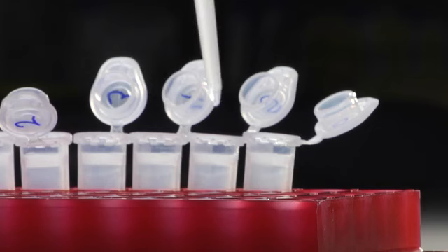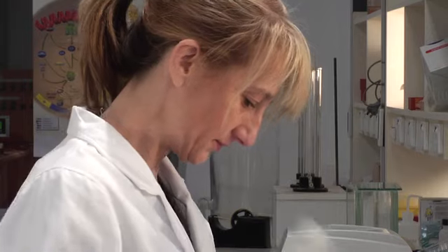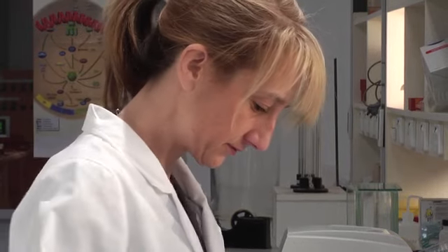Neutralization allows the plasmid to re-nature and become double-stranded and soluble once again. However, because the chromosomal DNA is so long, it can't re-nature. And then it's back in the centrifuge.